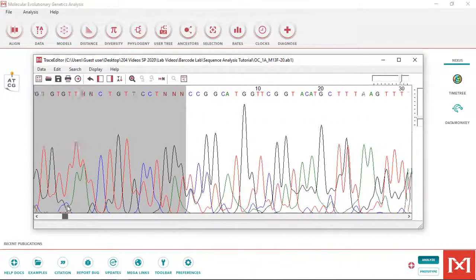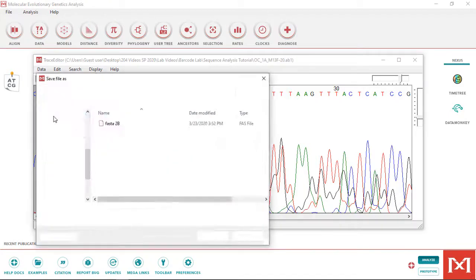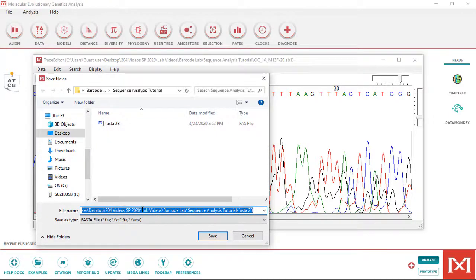Once you have reviewed the entire sequence and are happy with your editing, go to Data, Export FASTA file, and save the resulting file with a sensible name to your computer. Now you're ready to move on to the rest of the analysis.